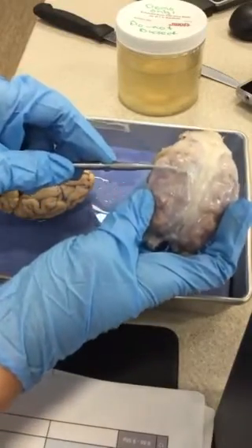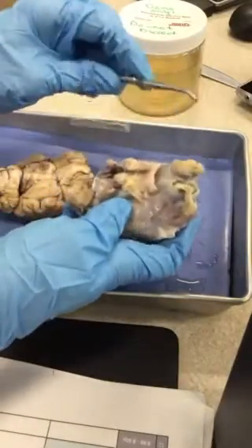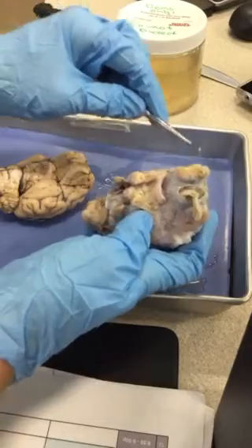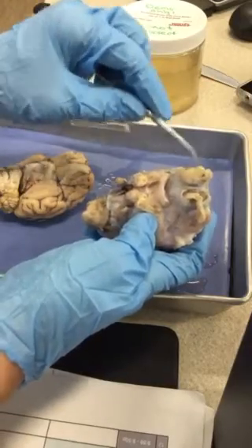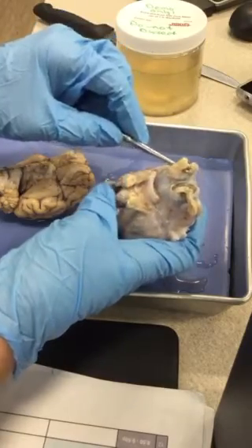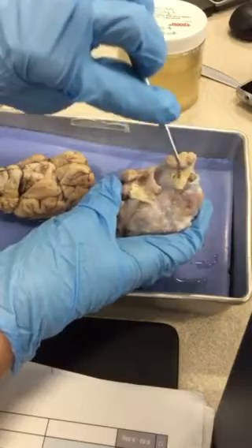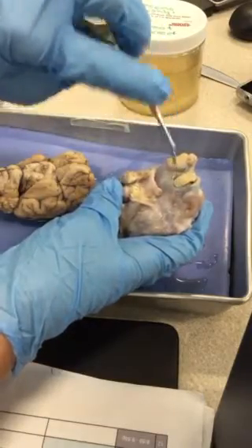Okay, so that's the Dura Mater, and then turning it over, looking at the underside, we can see those cranial nerves that you're responsible for. So the olfactory bulb here are these swellings. If you turn your sheep brain over, you should be able to see that those swellings make up the olfactory bulb. This one's a little bit ripped up, but you can see.